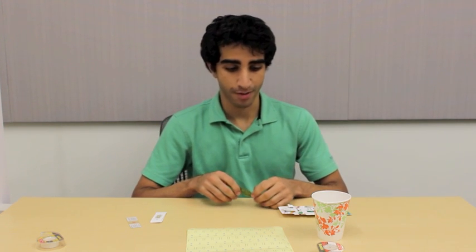In this tutorial, I'll show you how to mount dry samples, such as leaves, insects, and hair, and wet samples, such as pond water or saline solution.